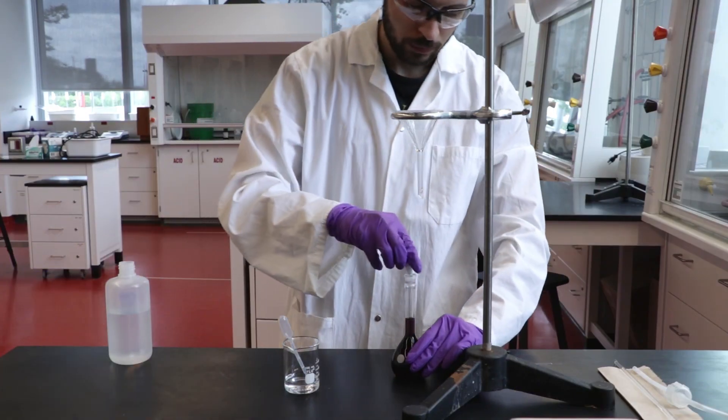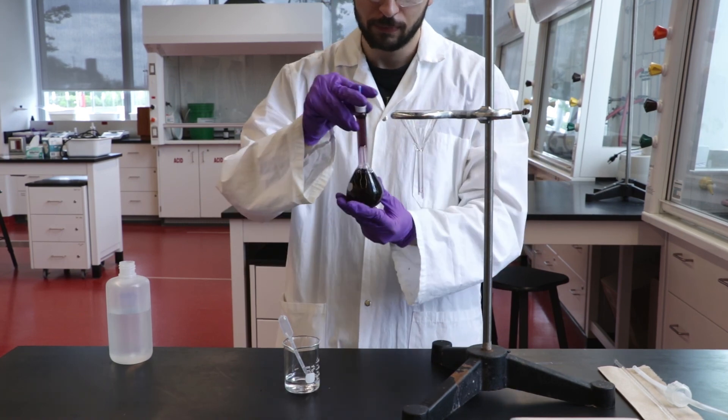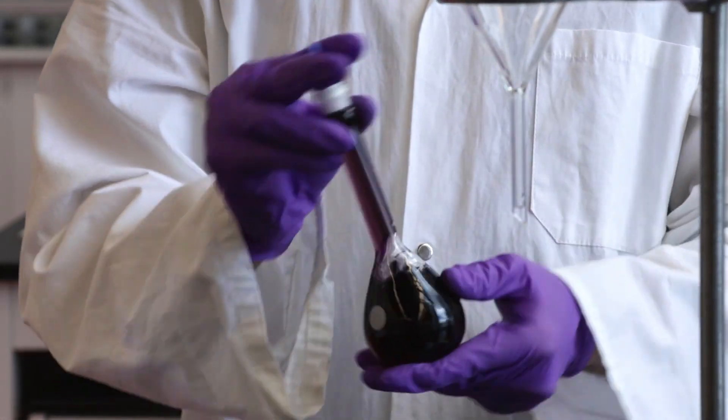Stopper and invert the flask 15 to 20 times to make sure the solution is fully mixed. Hold the stopper while inverting to ensure it remains securely in place.